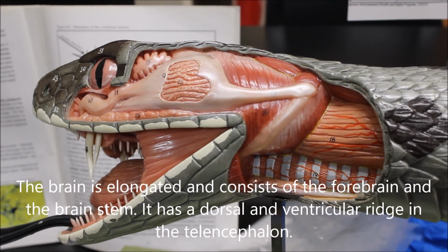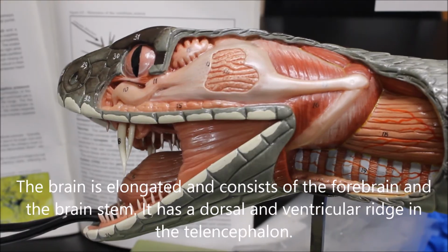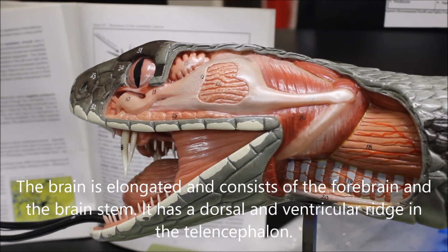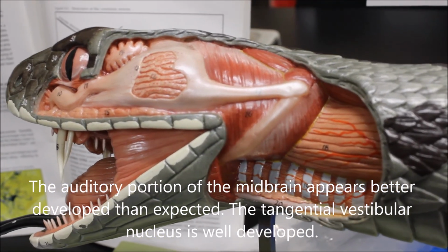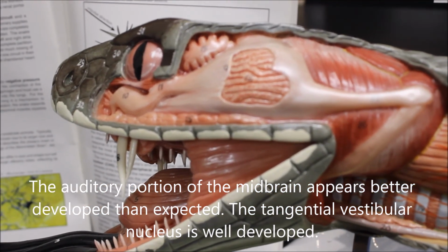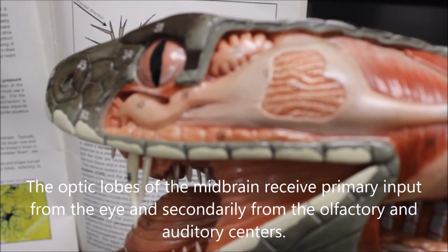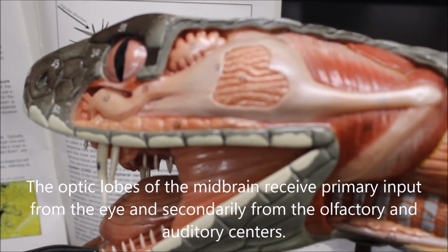The brain is elongated and consists of the forebrain and the brainstem. It has a dorsal ventricular ridge in the telencephalon. The auditory portion of the midbrain appears better developed than expected. The tangential vestibular nucleus is well developed. The optic lobes of the midbrain receive primary input from the eye and secondarily from the olfactory and auditory centers.